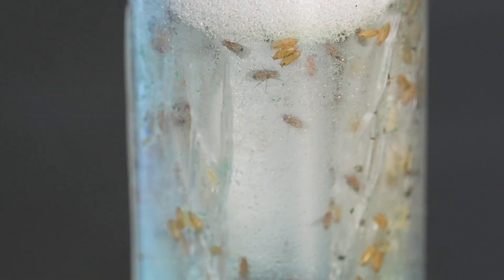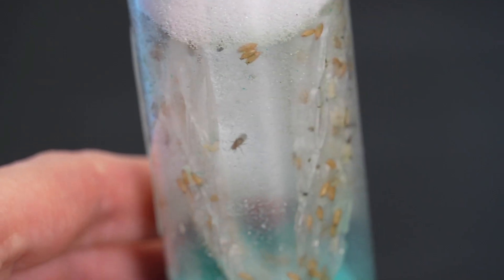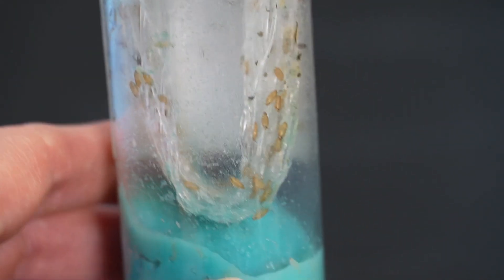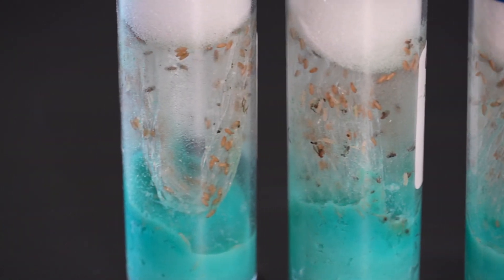It turns out that we don't have to rely on our imaginations to understand this phenomenon. We can observe and test it in the lab using real fruit flies, aka Drosophila melanogaster. Drosophila is a star in the scientific research community — it's so well studied that it's known as a model organism. It's teeny tiny, not picky about where it lives, super easy to raise in a laboratory, quick to develop from egg to adult, and easily manipulated in behavioral and genetic experiments. It's pretty exciting that we get to work with these little superstars today — I feel like I'm meeting a celebrity!